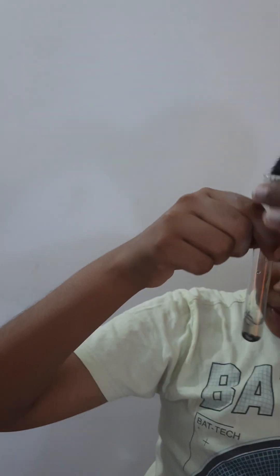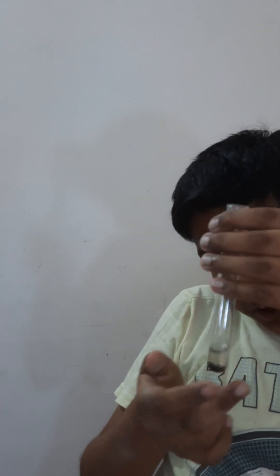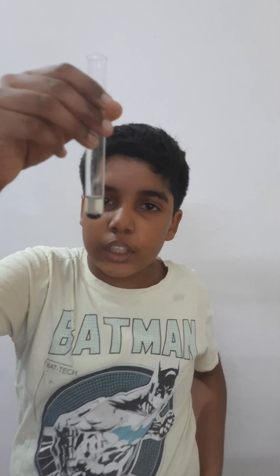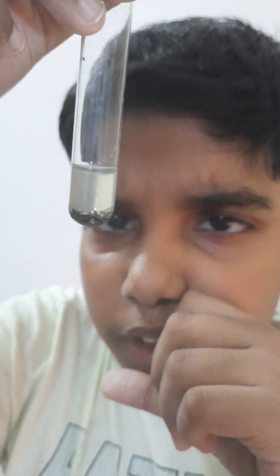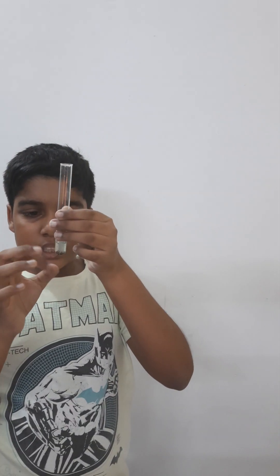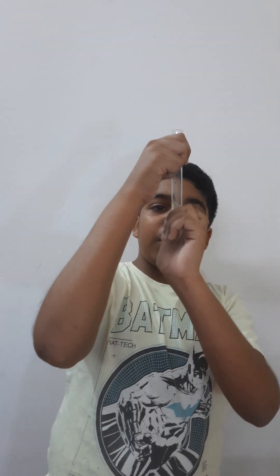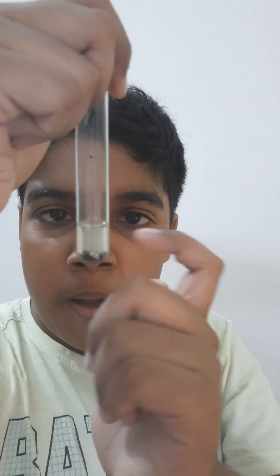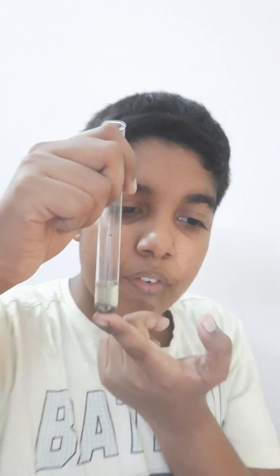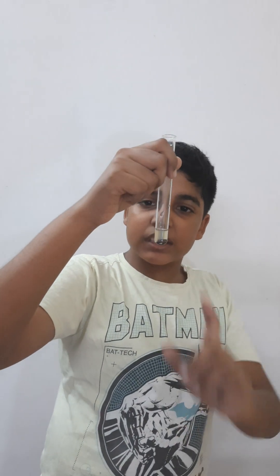I have to wait for some time — it does not take much time but can sometimes take longer. You can see a very light shade of green being observed on the surface, and after some time it gradually turns green. This tells us that copper sulfate reacts with iron. The green chemical is iron sulfate, and what is left on the bottom surface is copper.